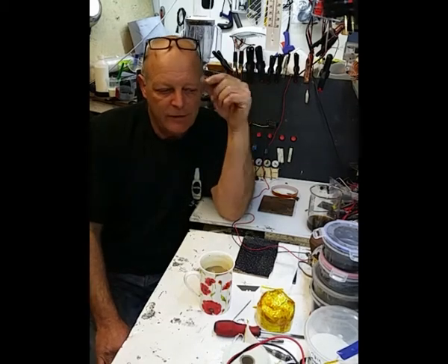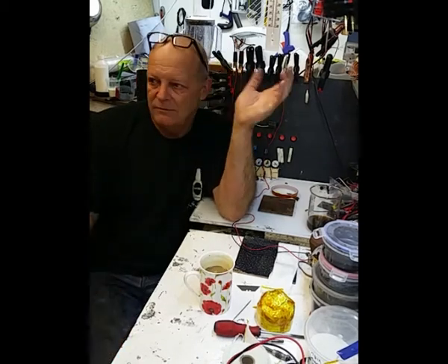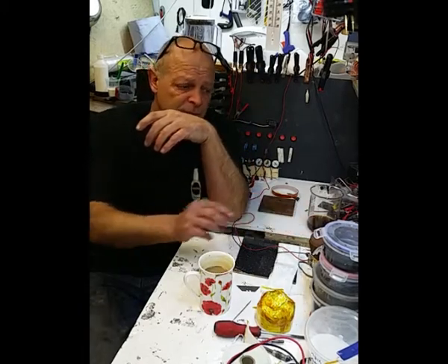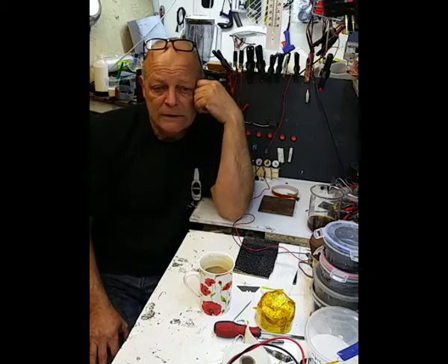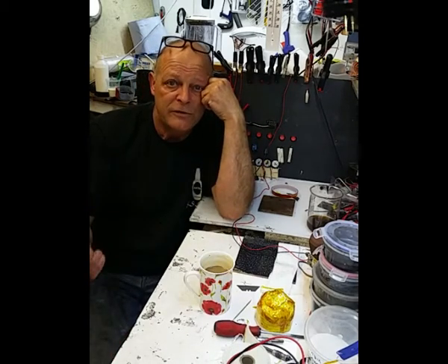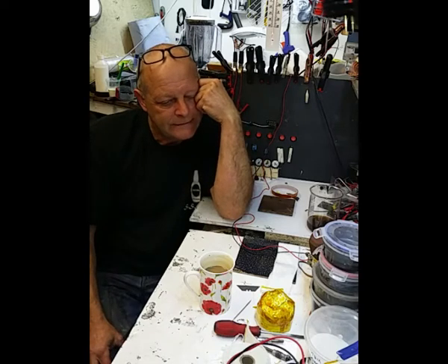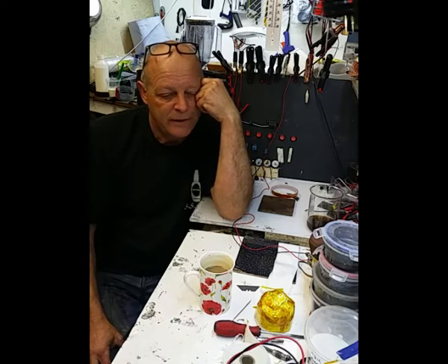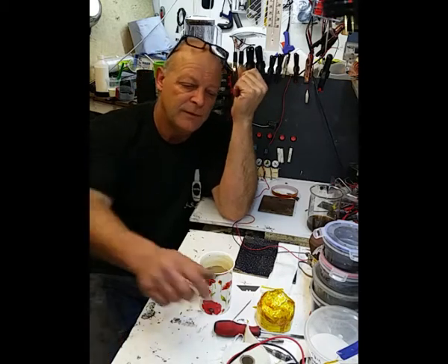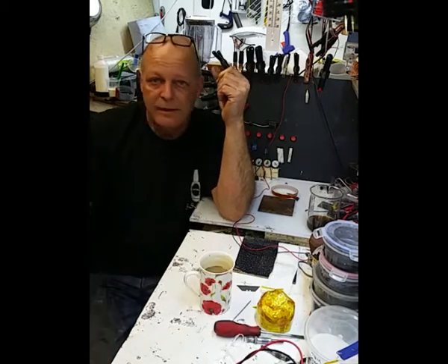One of the things I said earlier on in the video was that I hadn't got anything to wrap this item up, this chamber. I've got nothing to wrap it up in as a thermal barrier. Well, I must have been dreaming about it, because I woke up thinking, what an idiot. And on the shelf just there, I've got this stuff.